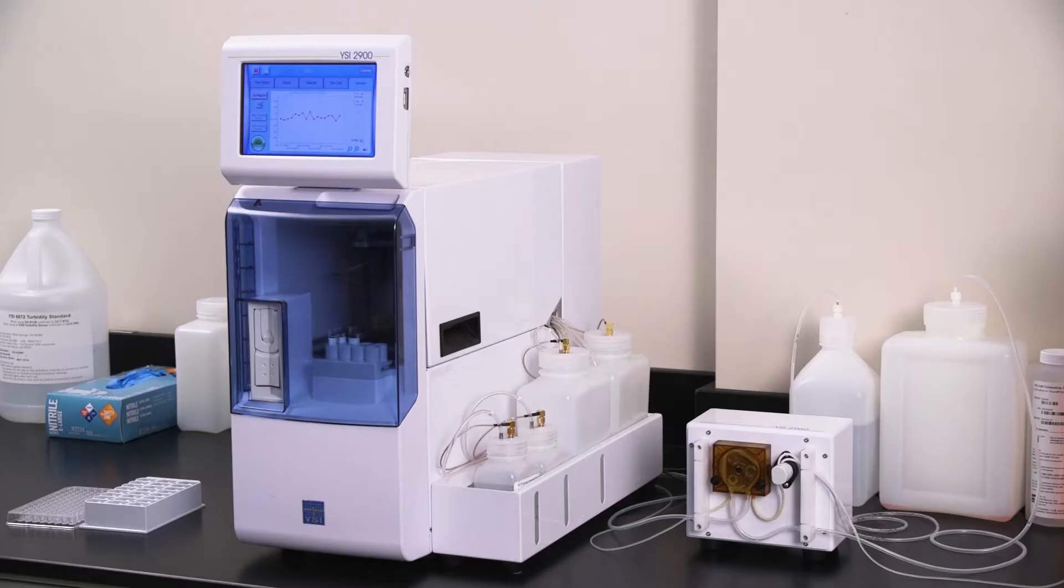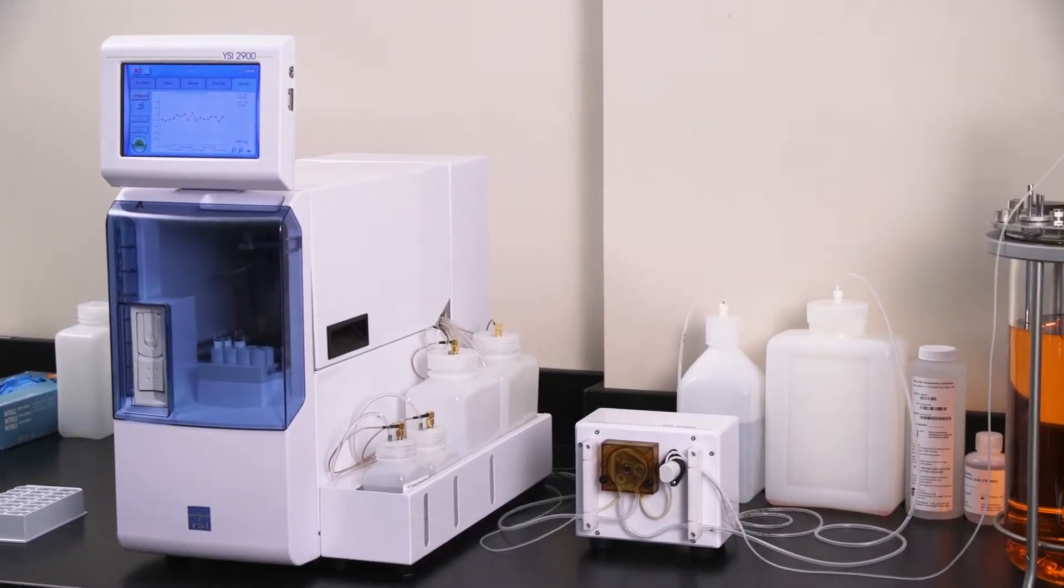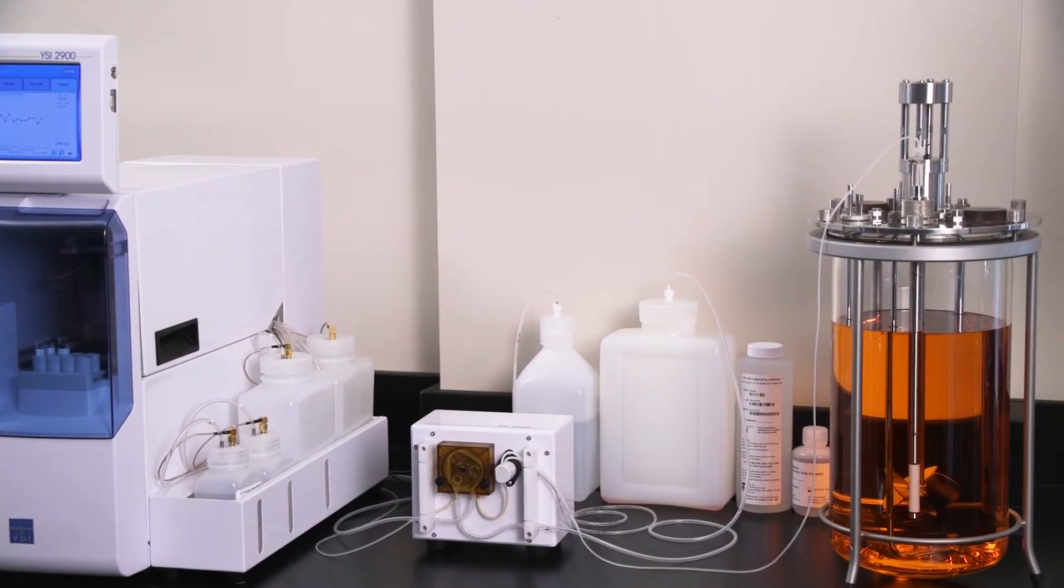Connecting the online monitor to your YSI Biochemistry Analyzer. First, we'll connect the electrical and data cables.